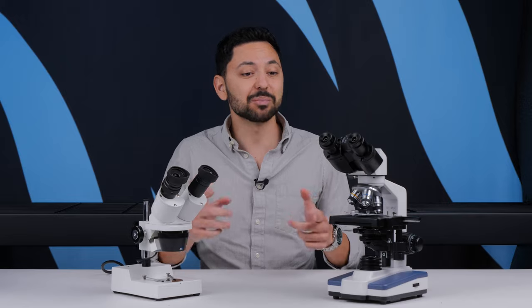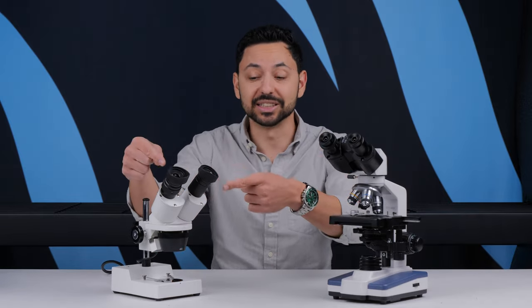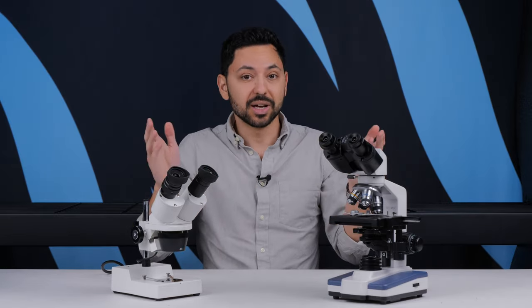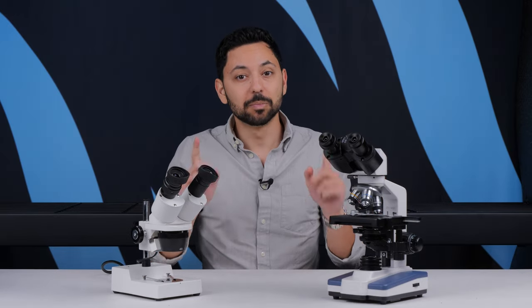What's the difference between a stereo microscope and a binocular microscope? Well, a binocular microscope just implies that there are two eyepieces that the microscope is using. So these are both binocular microscopes.